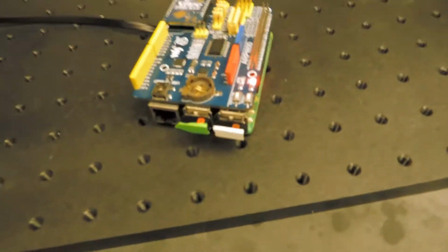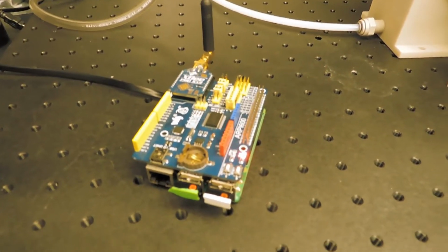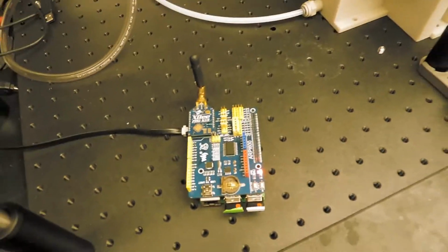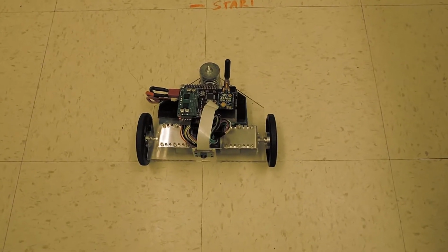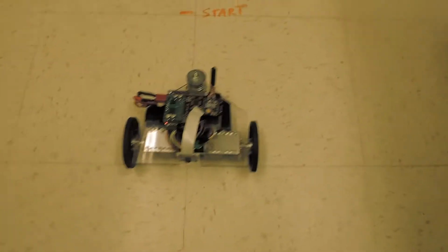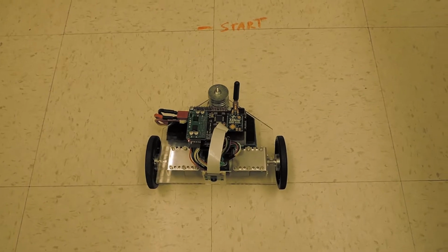And this is being sent over to a Raspberry Pi. It's being captured by a Raspberry Pi, which uses a 900 megahertz XBee to transmit motion commands to the Telepresence robot right here. It was 900 megahertz because we had some specific length requirements, or transmission length requirements.